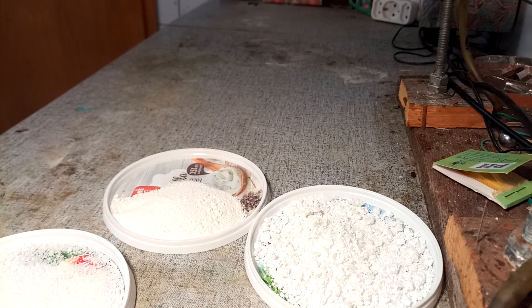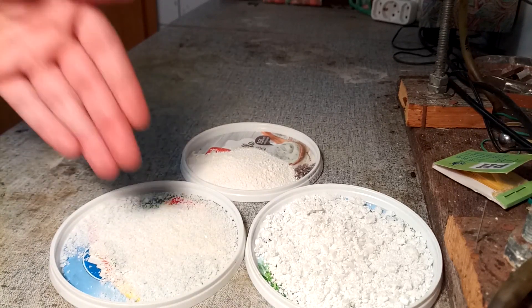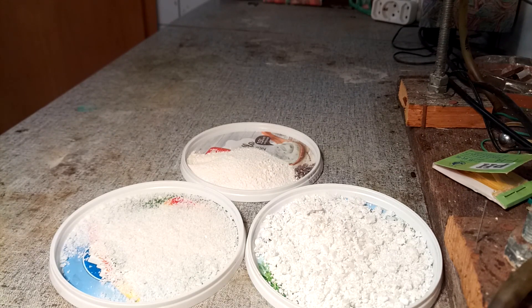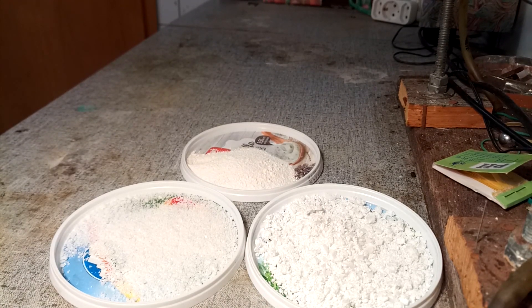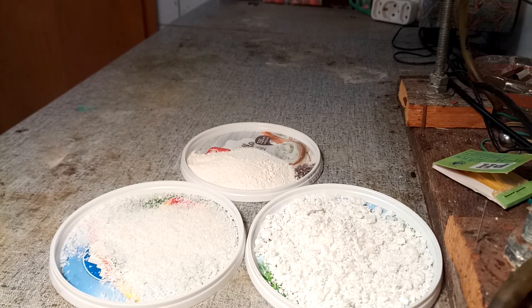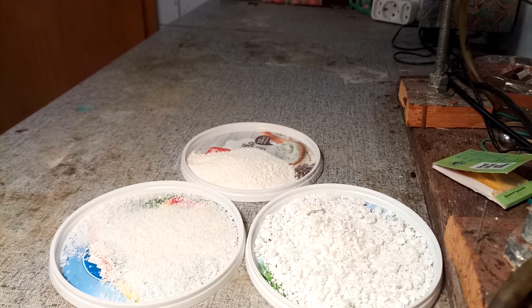We can cheat a little here because we know the nitrate content of these two recovered portions of nitrate. So if we subtract that from our starting material, we can calculate a new yield of 32.5 percent. And you know what, 30 percent yield — that's pretty alright.